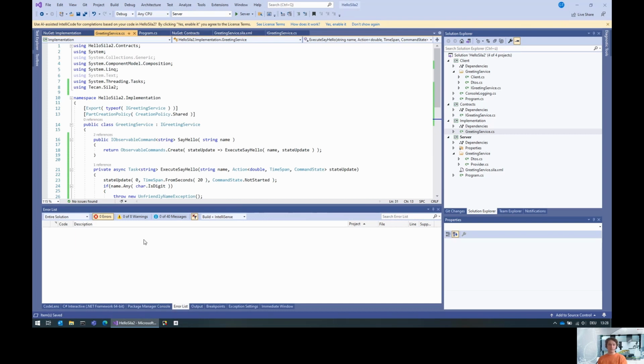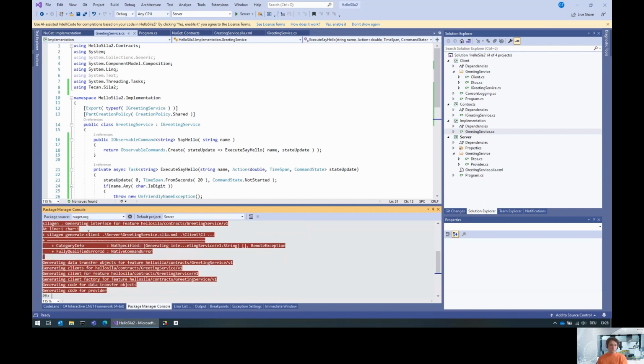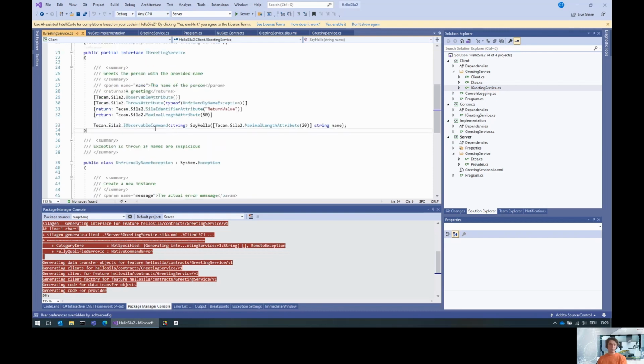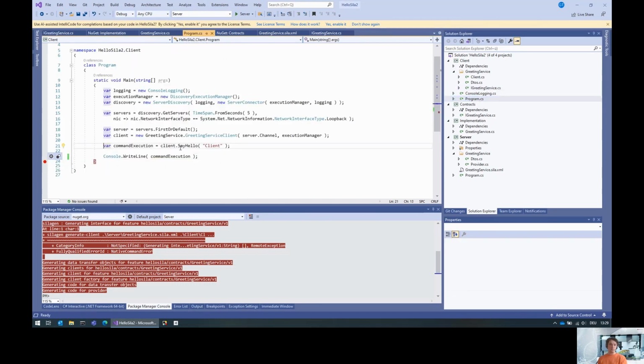Yeah, then let's go to the client. I actually forgot to remove the stuff from previous code, so that might have spoiled something. If we regenerate the client code, we basically get the same thing, an observable command of string to say hello. And here we can say hello, and what we get this time is an observable command, and we write the response result to the console.